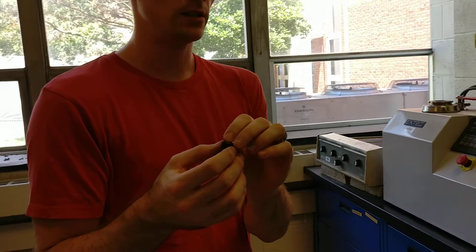We're going to take the piece that we cut with the abrasive saw and hot mount it. Hot mounting you shouldn't do to low melting temperature metals like aluminum because it could change their microstructure.